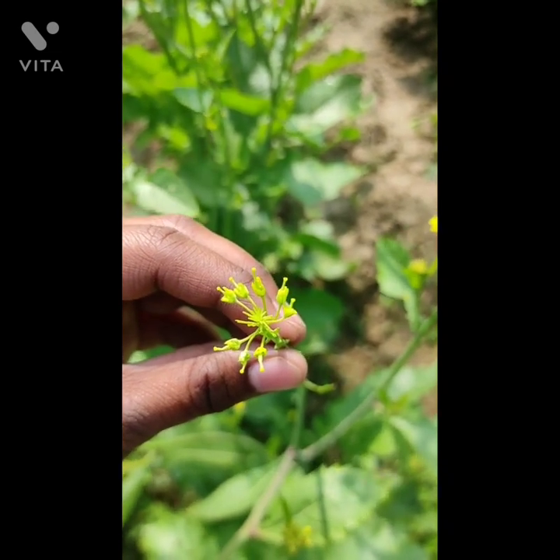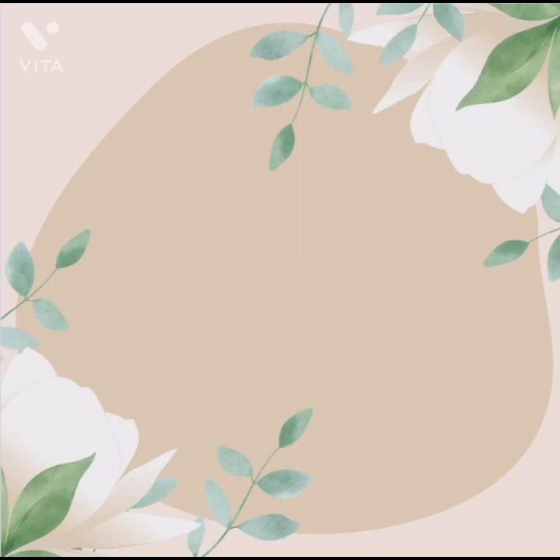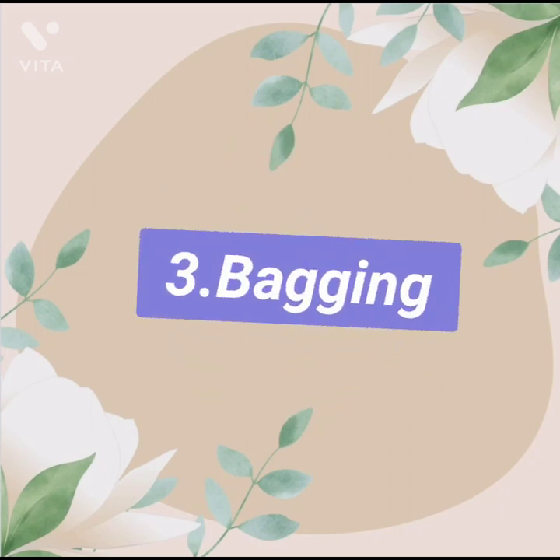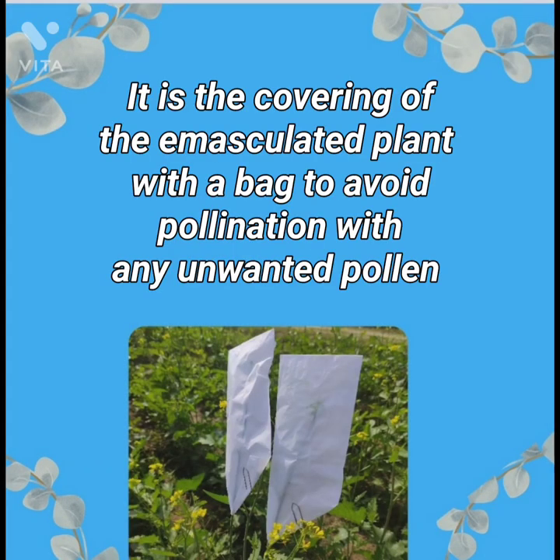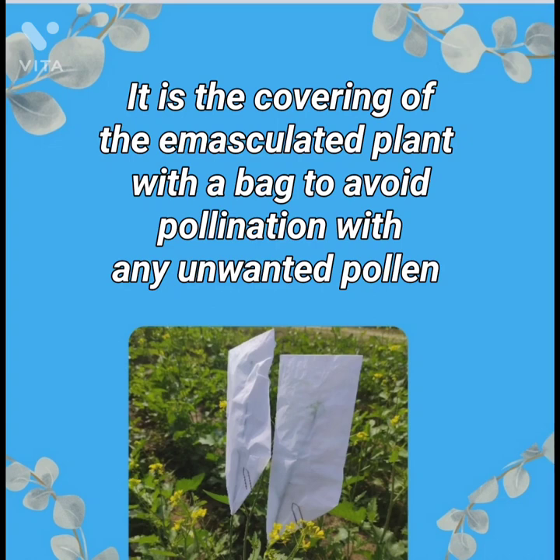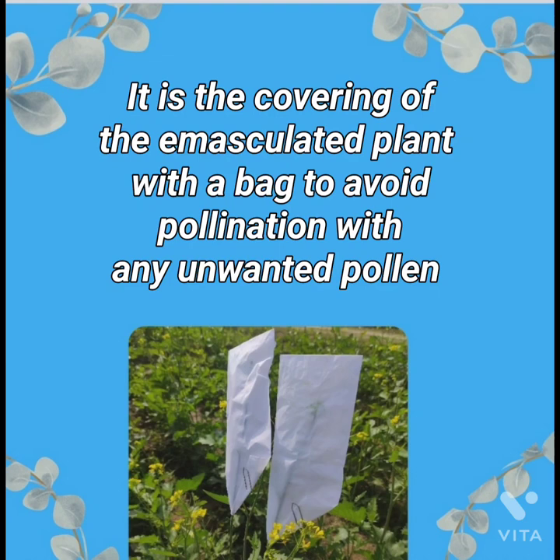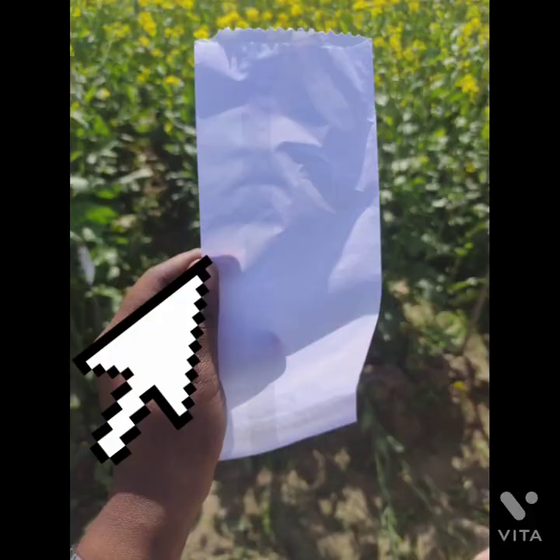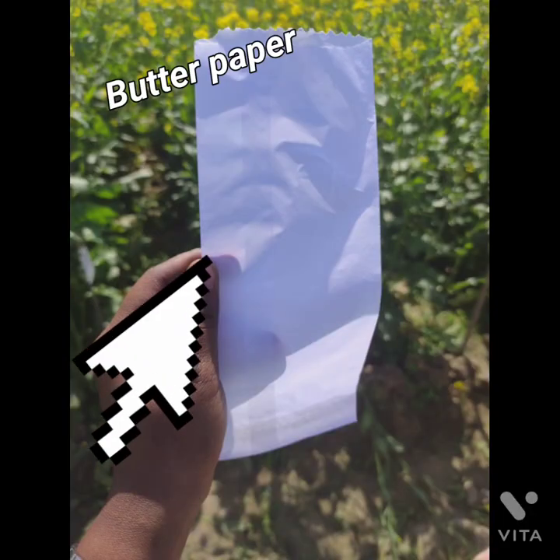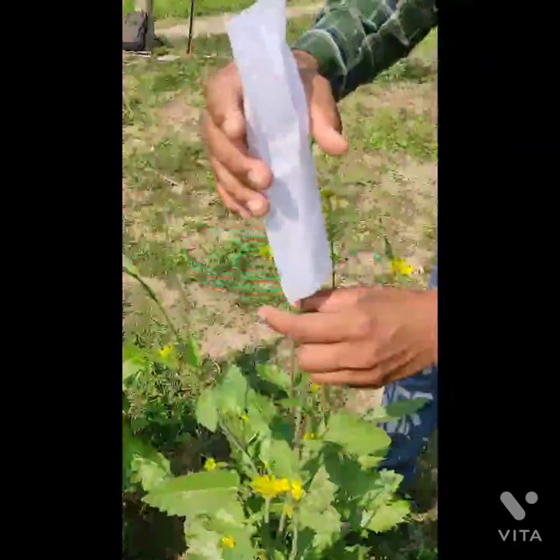This is the female plant after emasculation — see how beautiful it is. Next is bagging. The definition of bagging: it is the covering of the emasculated plant with a bag to avoid pollination with any unwanted pollen. Bagging has to be done immediately after emasculation. To do bagging, we use butter paper and also U-pins.